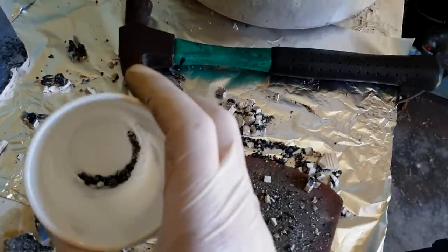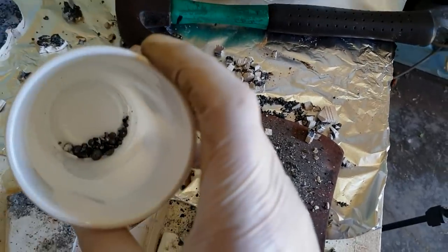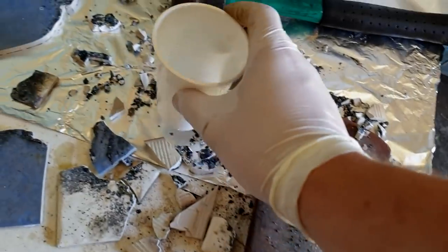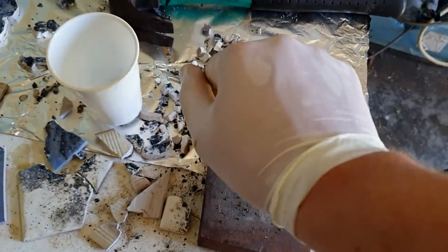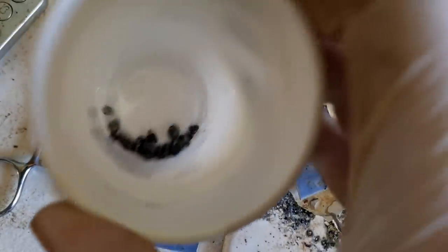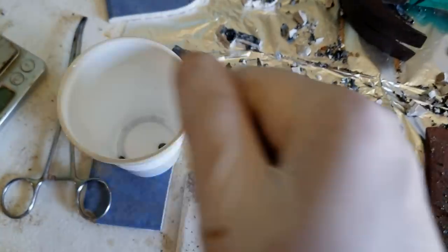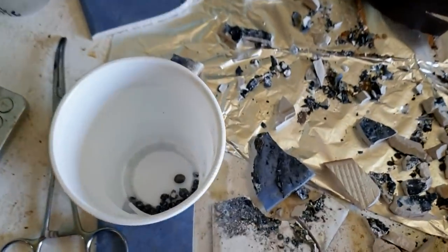Alright, so I managed to collect four grams here. None of them are huge lumps — I've got one or two reasonable-sized amounts, but four grams is not a whole lot. I'm tremendously sweaty. I could pick through this stuff forever. Obviously they're not very high purity, and it's hard to tell the difference between melted aluminium and vanadium — if it's a little lump of metal I'm picking it out. I'm fairly sure some of these are just aluminium bits that didn't react and just melted together into a little ball.